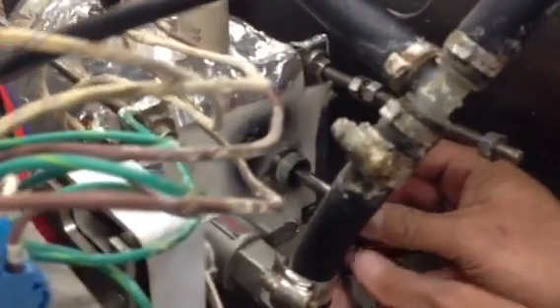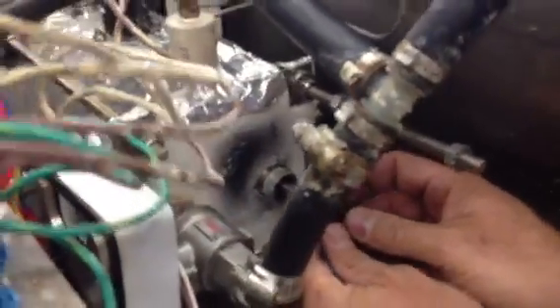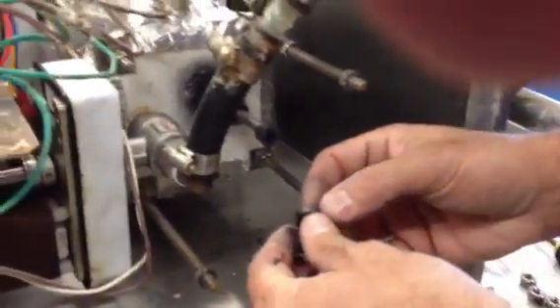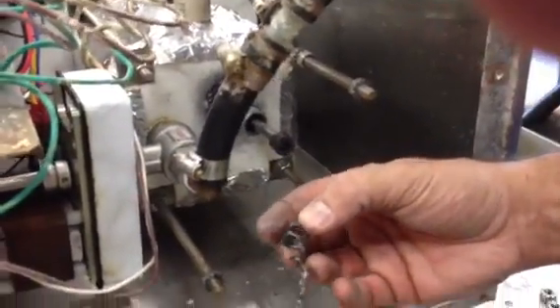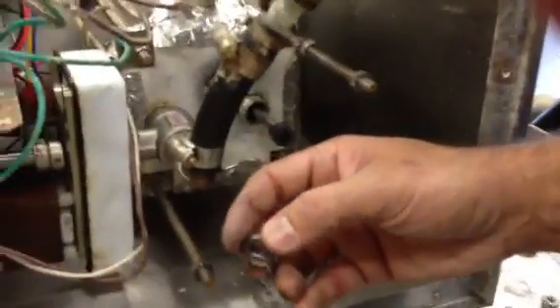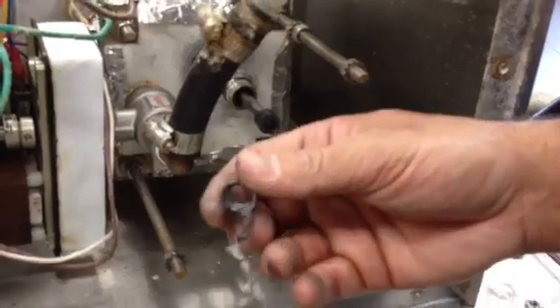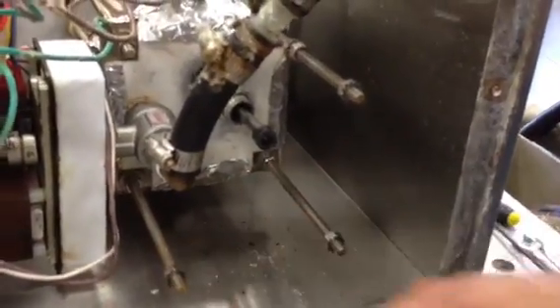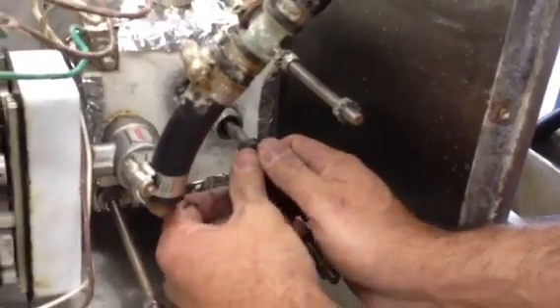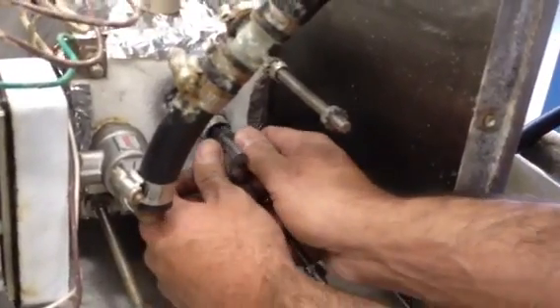Then once you have the first rope in, the graphite cylinder is easier to get up inside than the rope. Basically slide this over. You want to be careful when you're sliding this on, because if you don't, you could break it apart and it will fray like this. And this is a damaged piece, and you do not want to use this if this happens. So it's probably not a bad idea to have a couple cylinders on hand too. Basically, once you start that, this will slide up the shaft.